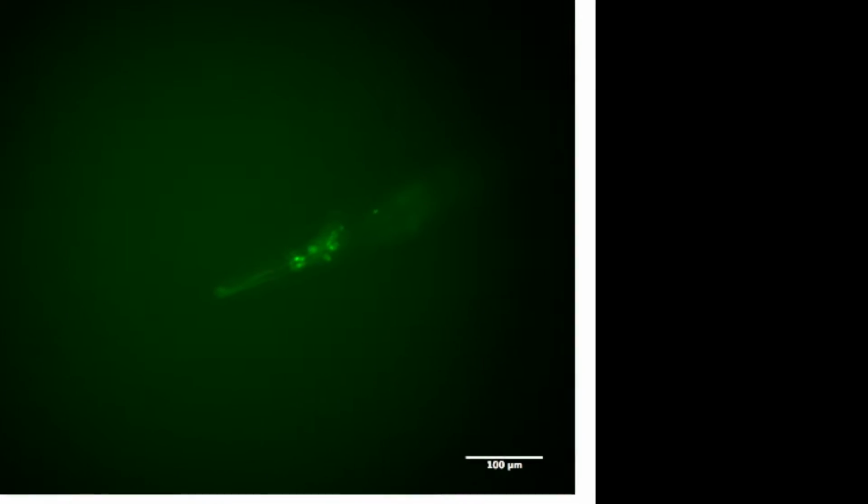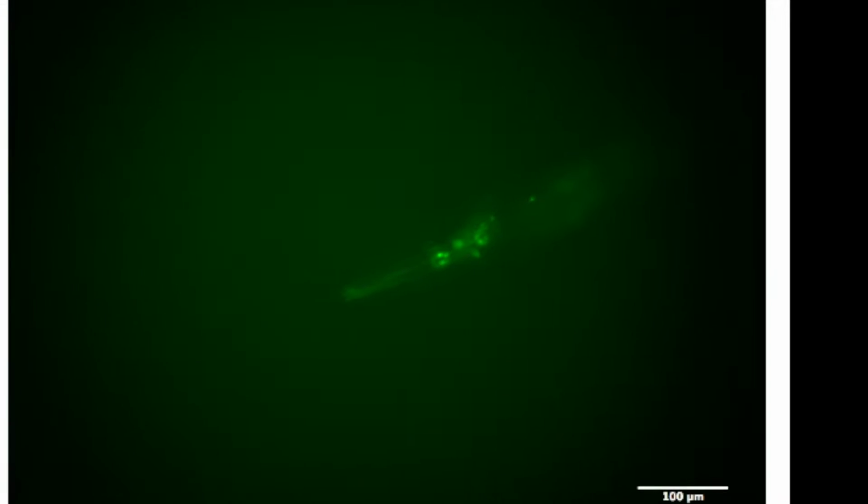After destaining, approximately 20 worms were picked onto an agar pad. The worms were placed under a fluorescent microscope, counted and categorized as neuronal dye-filled and non-dye-filled. The percentage of the worms that were dyed normally and those that were dyed defectively were then calculated, and an image of the fluorescence was taken and data was recorded.